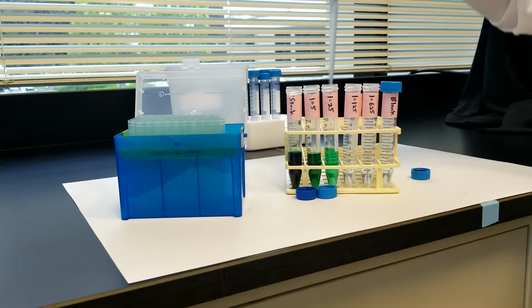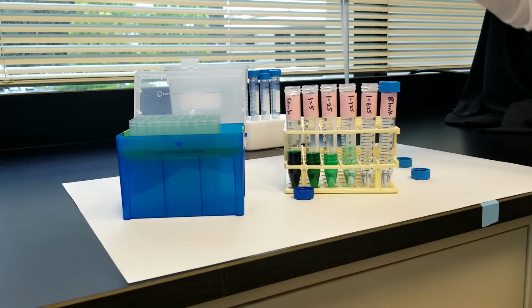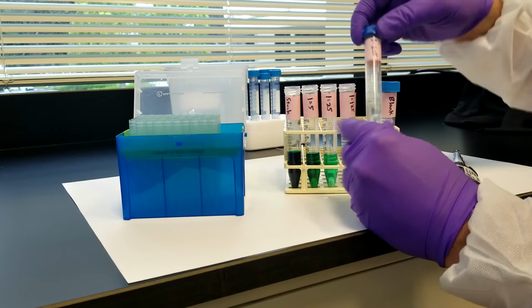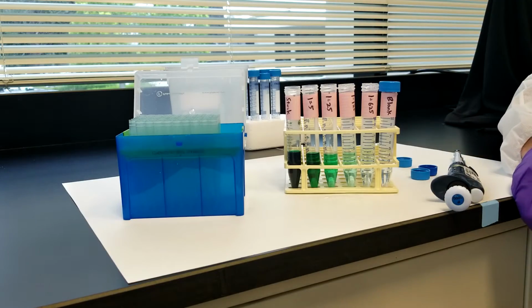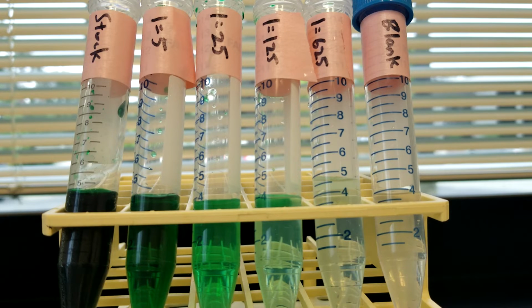At this point, we will perform 2 additional serial dilutions, using a fresh tip for each transfer step and mixing thoroughly afterwards to prepare the 125-fold and 625-fold standard dilutions, thus completing a 5-point standard curve, which, along with our blank solution, can be used to accurately measure concentrations of our molecule of interest in unknown samples.